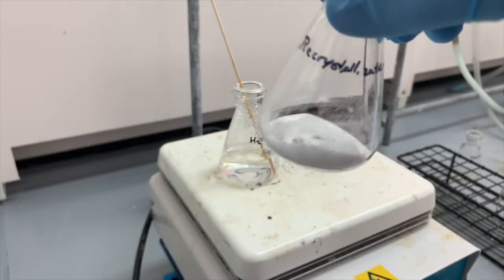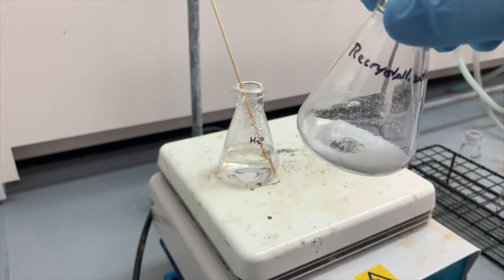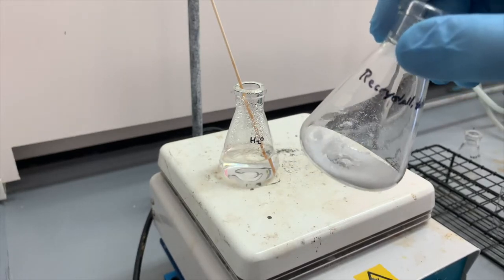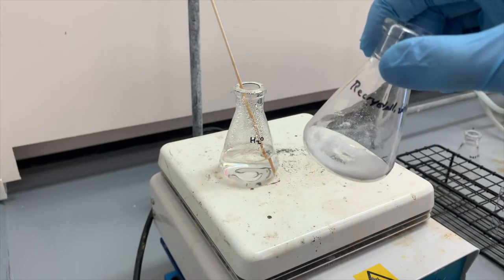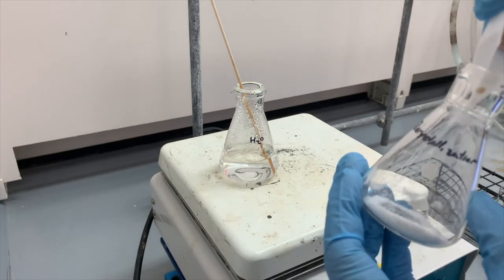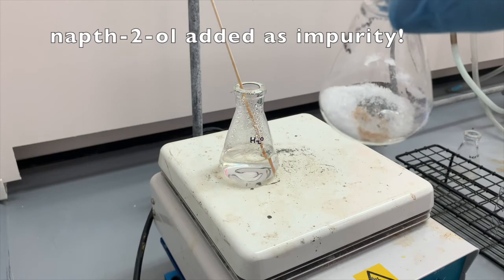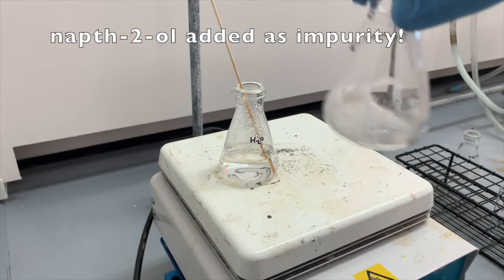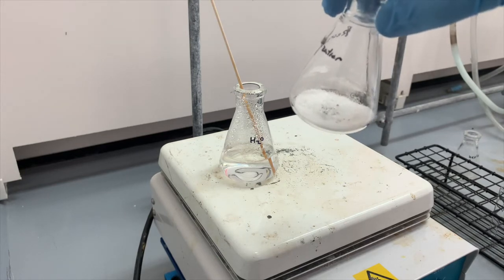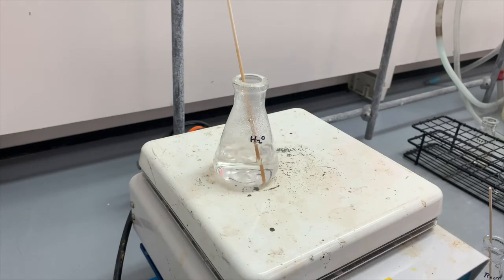Here is our material that we're going to use for our crystallization — it's 1.82 grams of the organic acid that we recovered from our chemically active extraction. Our TLC lab showed us that this material is already quite pure — we only had one spot when we ran its TLC. So I'm going to intentionally add an impurity: this is 0.03 grams of napthol. I'm going to swirl that around to make it a nice mixture, and I'm going to take a very small amount of this — about 10 to 15 milligrams — for TLC analysis. Then we'll be able to see how well our recrystallization purified this material.